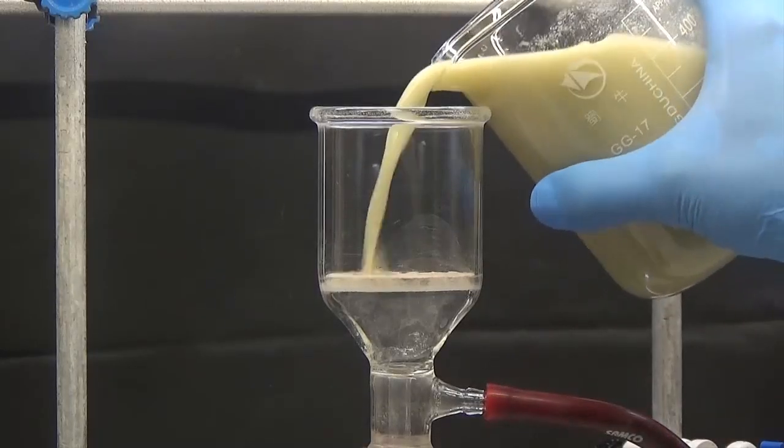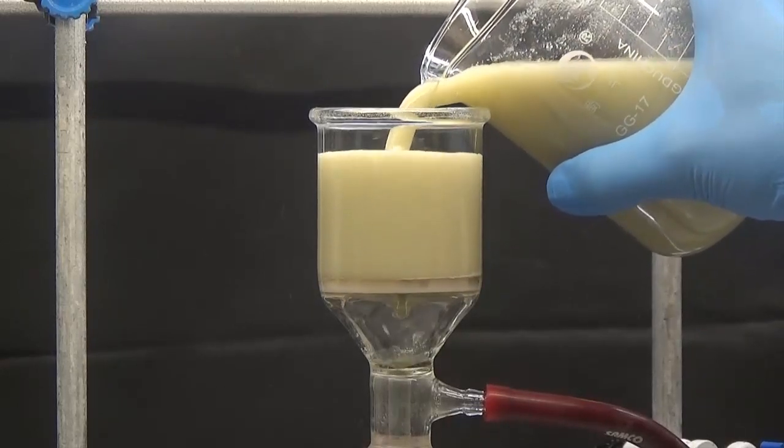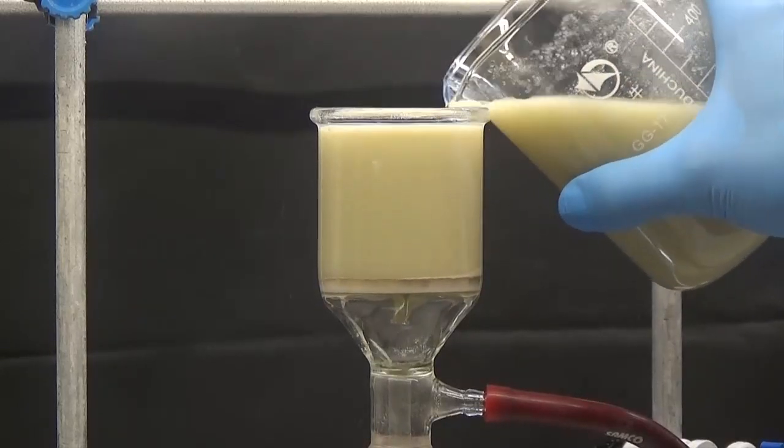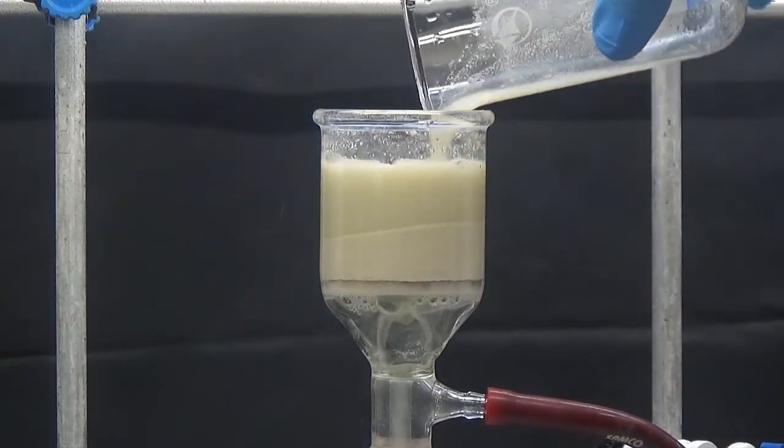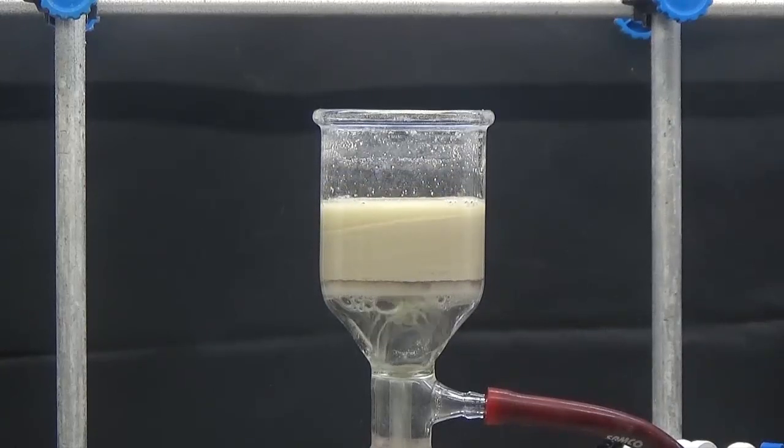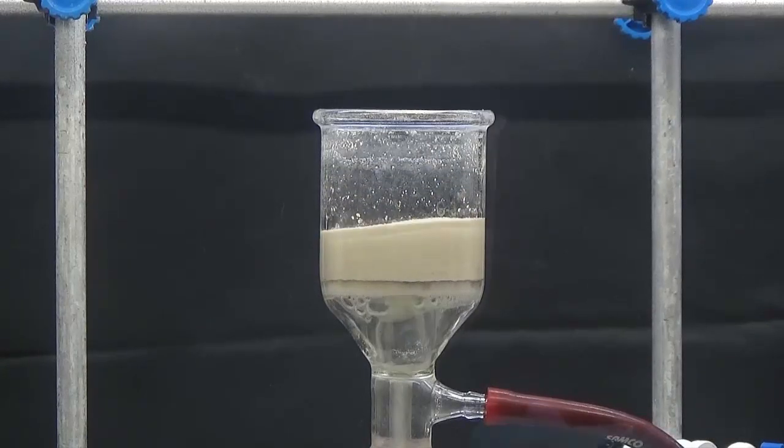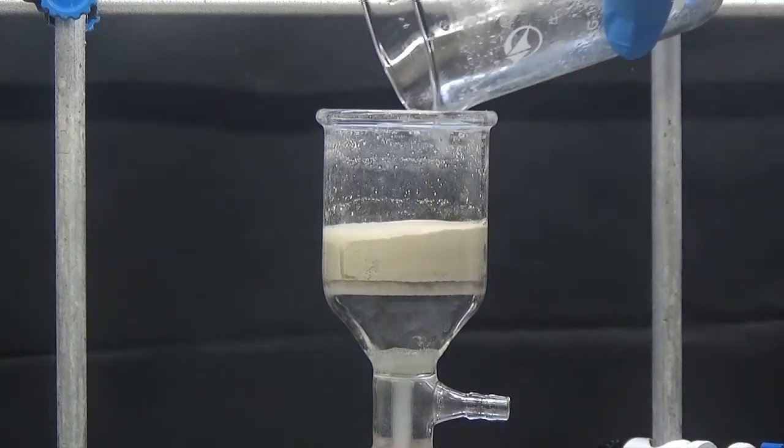Collect the precipitate by suction. Wash 3 times with 5 ml of cold water.